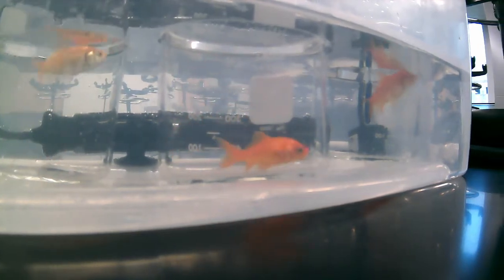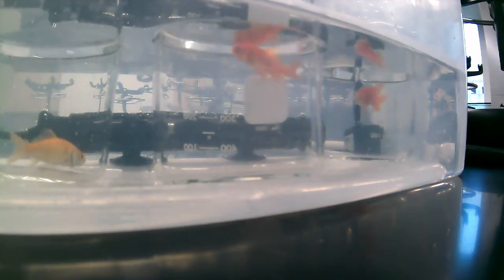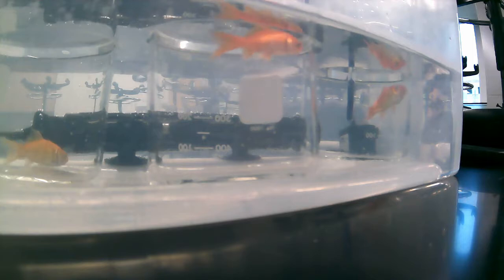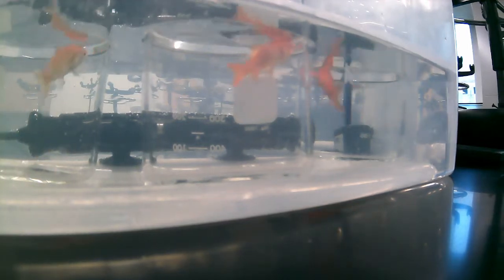The average number that we get for these three specimens then becomes the critical thermal maximum temperature for this species. So that's what we're going to use to compare to other species in the literature.